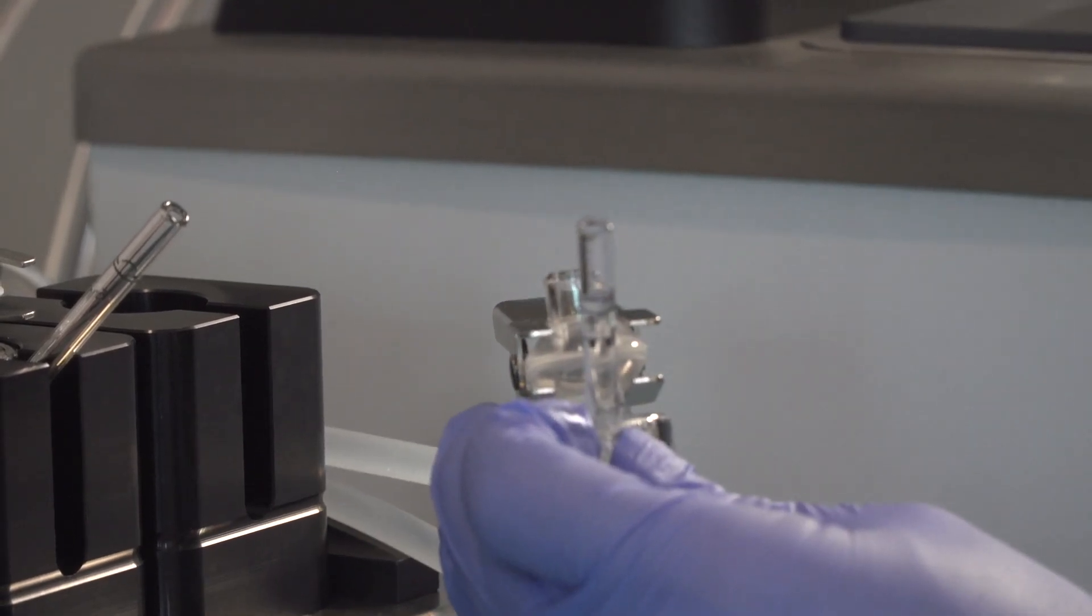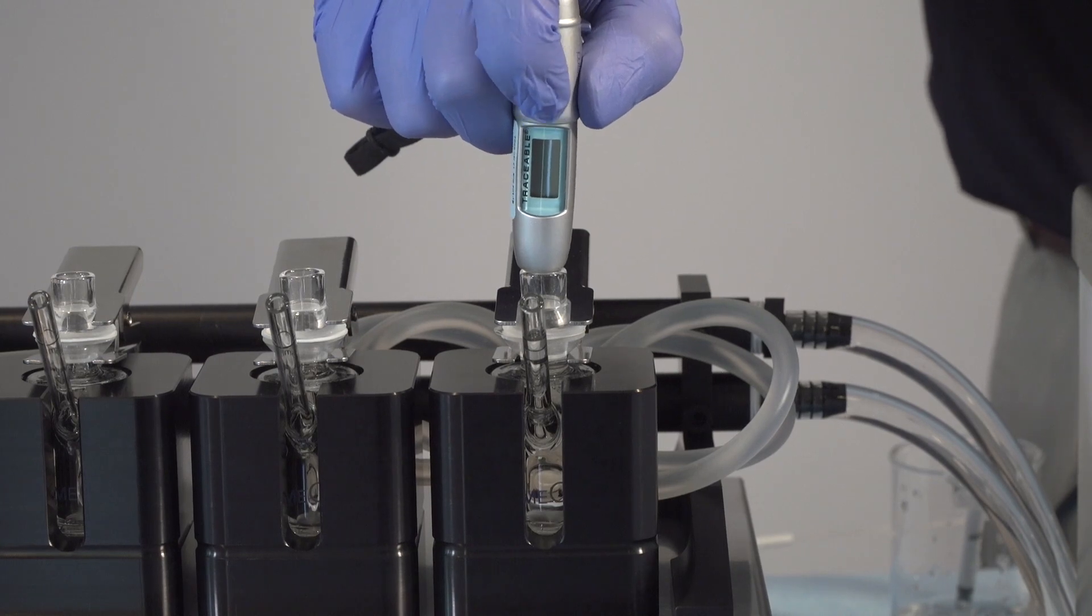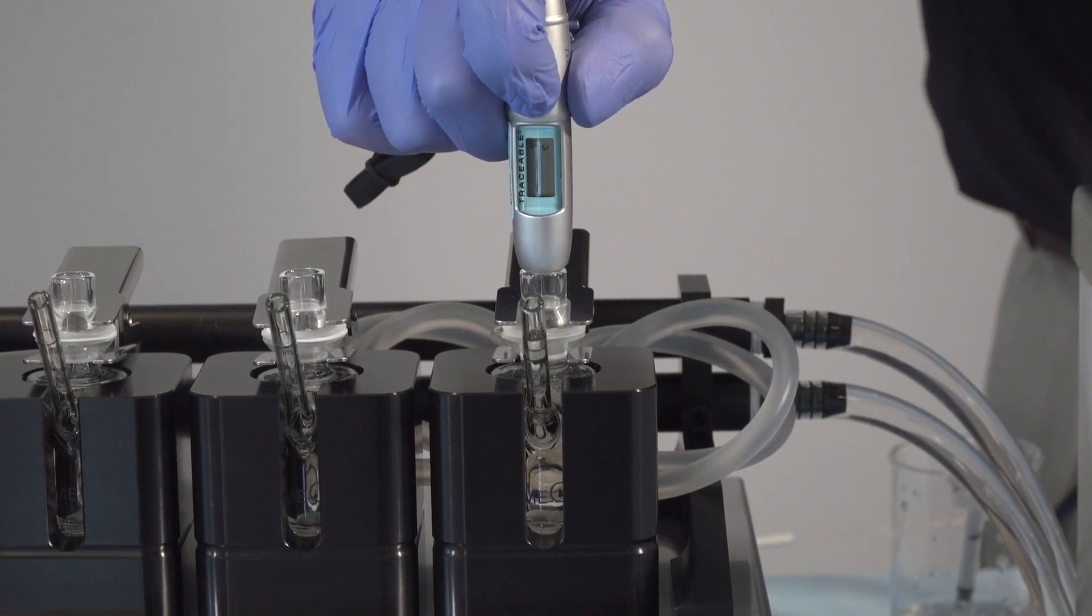Prior to doing anything, the membrane should be checked to ensure they are at the right test temperature. This can be done with a simple IR thermometer.